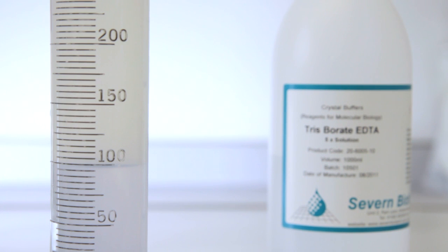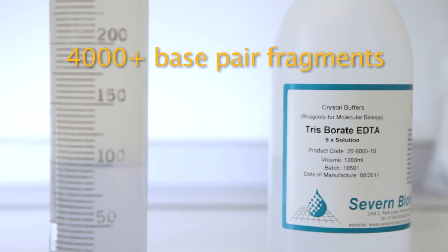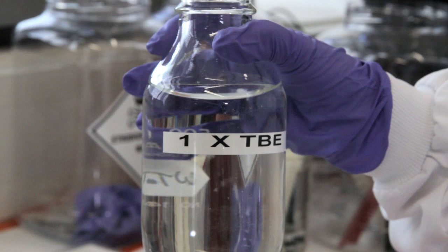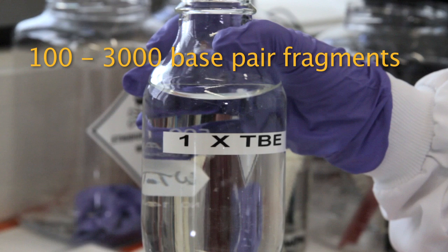TAE buffer gives better resolution of fragments greater than 4000 base pairs and TBE gives better resolution of 100 to 3000 base pair fragments.